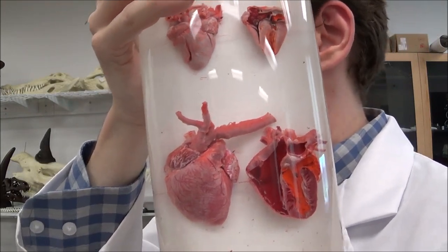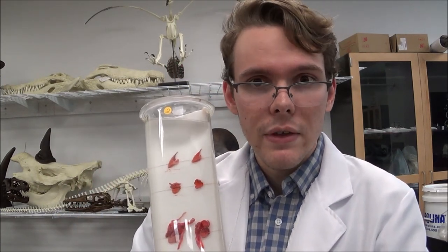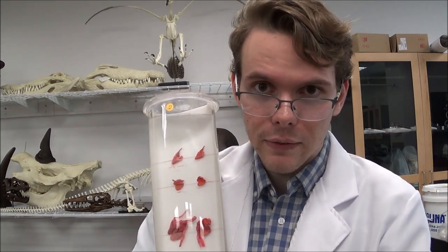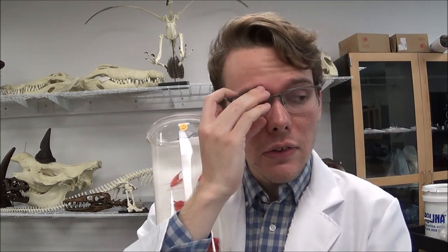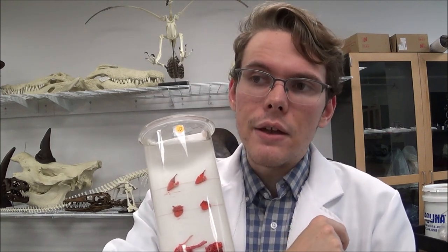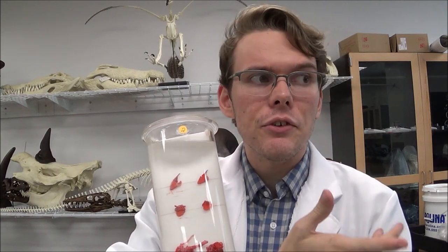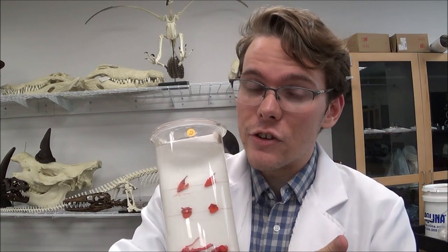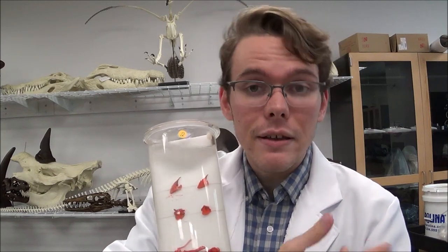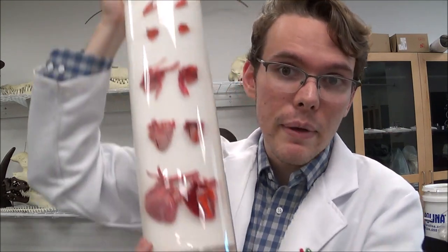And then that's a mammalian heart — this is a pig heart. I'm going to take a moment here to explain why we use pigs as our mammalian specimens for dissections. Pigs are, anatomically, one of the closest animals to us in a lot of ways. We use pigs in studies where we need to figure out what the effects on a human body would be. That's why we use pigs for dissections — they're so very similar, anatomically, to us. You get kind of an idea of what the human body's like, only you're dissecting a pig.